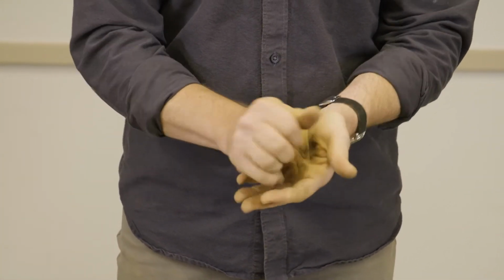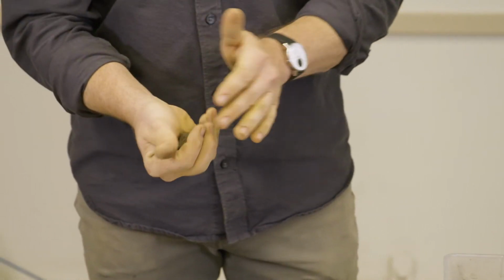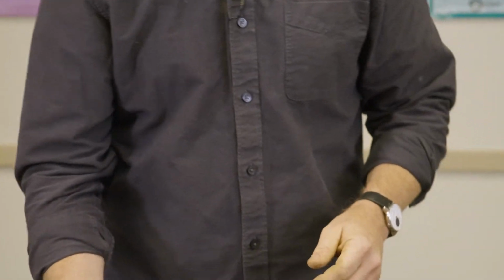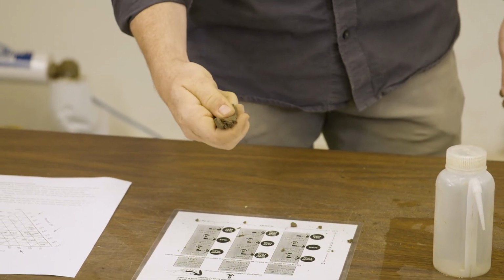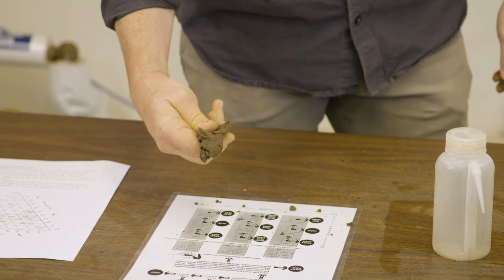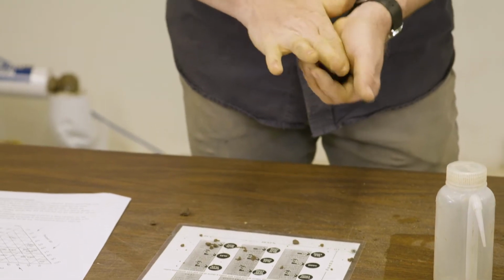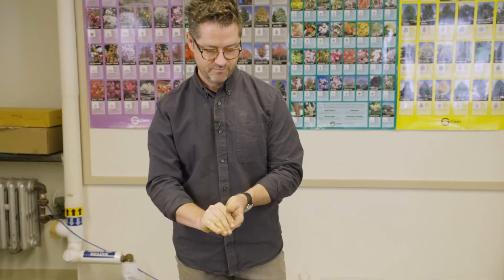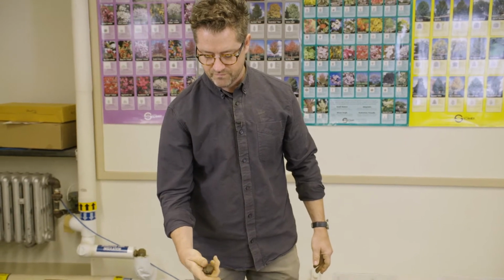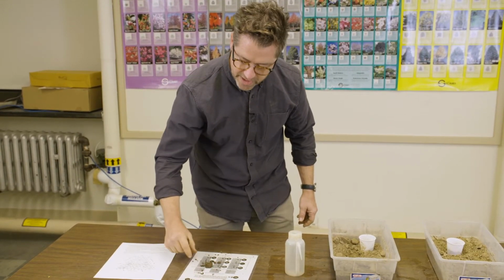Put it back into a ball form. It's dried out a little bit in my hand. Feed it a little more water. We don't want water to be squeezed out. Okay, going back to forming a ribbon. Squeezing it out. And it fell; this time we hit about an inch. We'll just do one more ribbon, and we'll take the average of the three. Okay, there it goes. It shattered when it hit, but just under an inch.